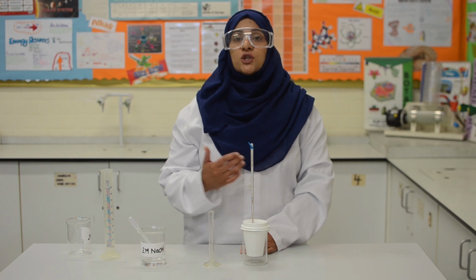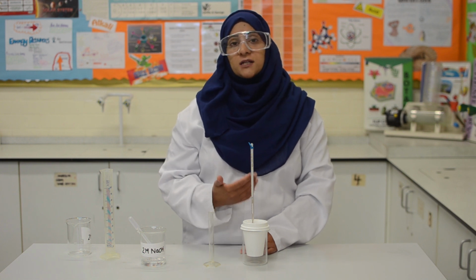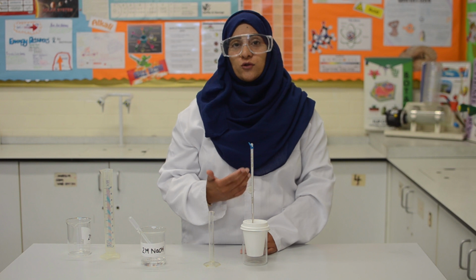This temperature should be recorded as the maximum temperature reached on addition of 5 centimeter cubes of sodium hydroxide solution.